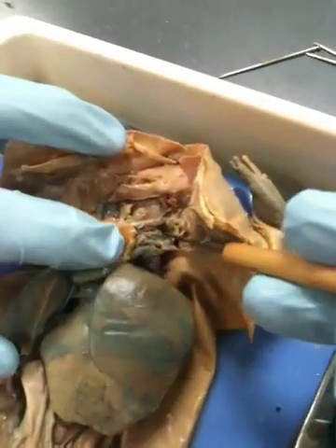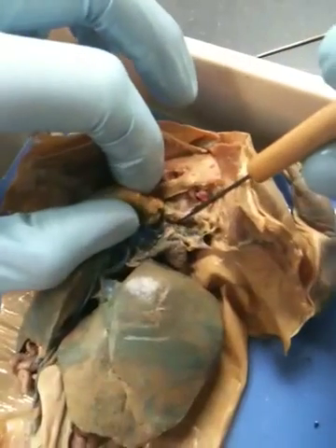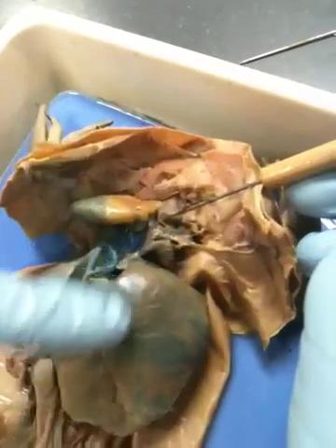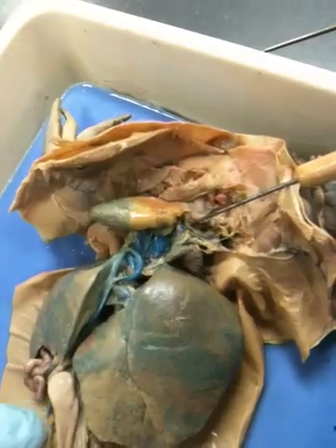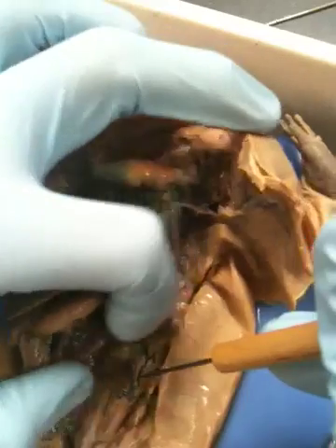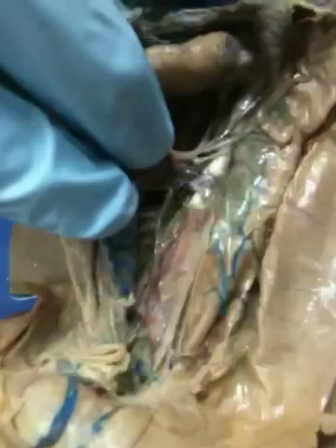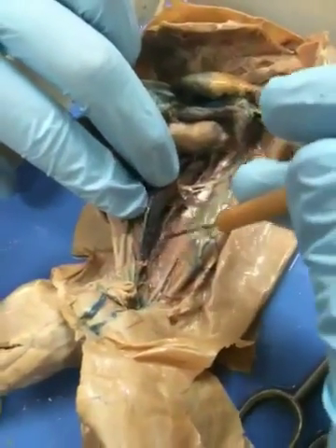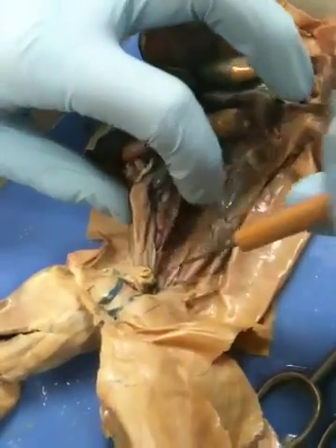From there we also have the systemic arch, which goes backwards and then goes back into the frog, and then it reforms in the middle and creates the renal portal arteries, which are somewhere around here. So they curve back underneath all of this stuff back here, and then it goes here, here, and then it goes to the kidneys, and from there it goes on down to the legs.